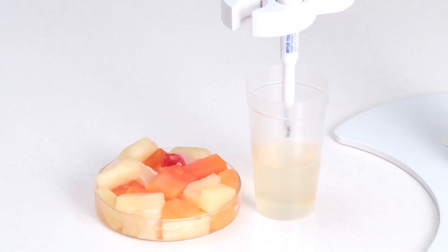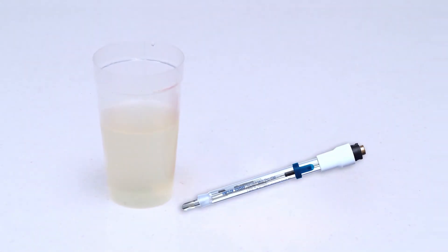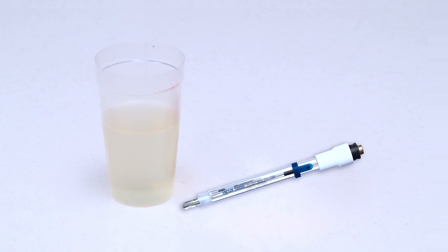For measuring the pH of brine, immerse the electrode in the sample. General sensor like InLab Max Pro-ISM can also be used for the pH measurement of brine samples.